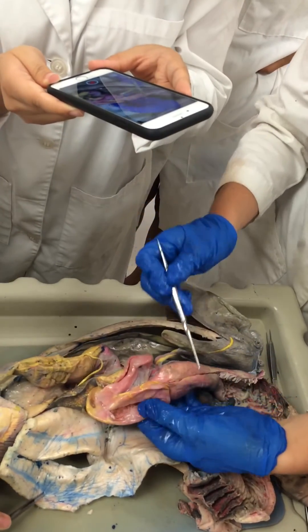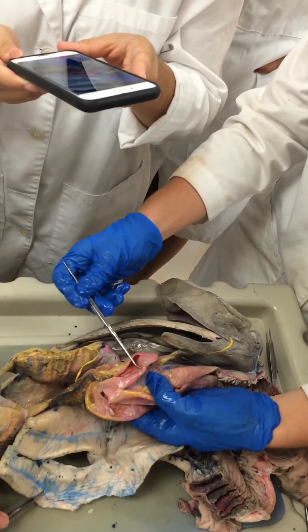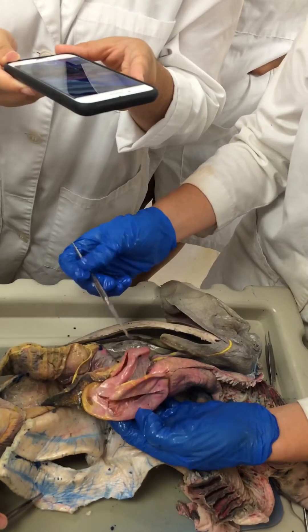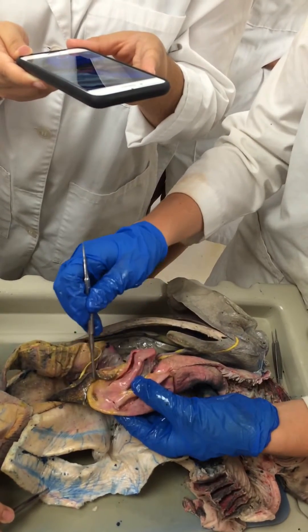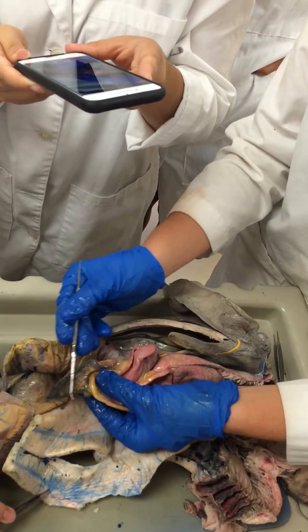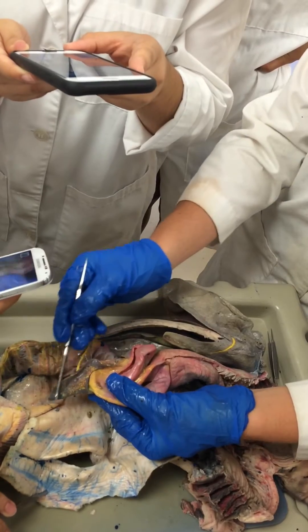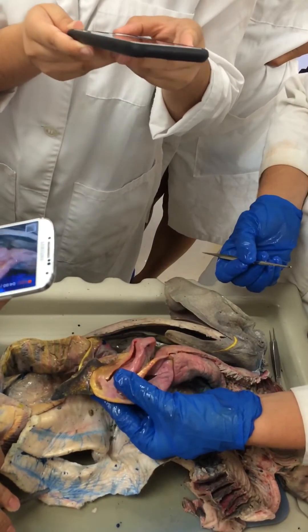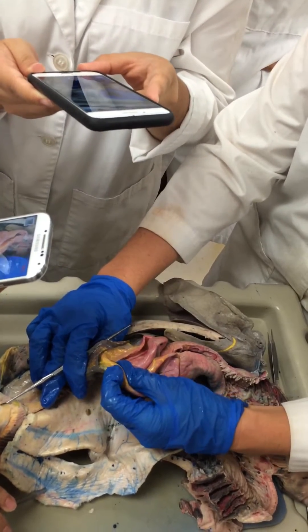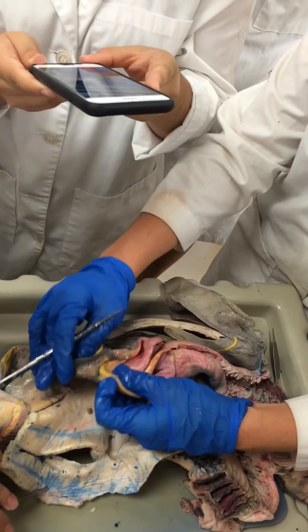There are three main sections of the stomach: this is the cardiac portion, the body of the stomach, and then the part coming up here is the pyloric region. The outside curve is called the greater curvature of the stomach, and the inside curve is the lesser curvature. This triangular green organ on the outside of the greater curvature is the spleen. The mesentery between the spleen and the greater curvature of the stomach — you can see how thin it is — that's the gastrosplenic ligament.